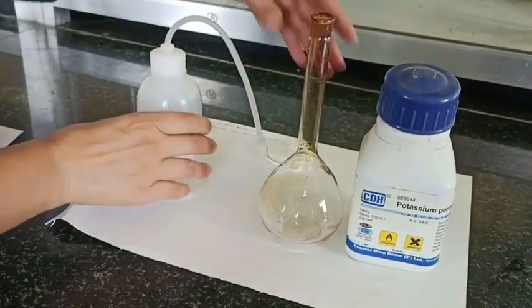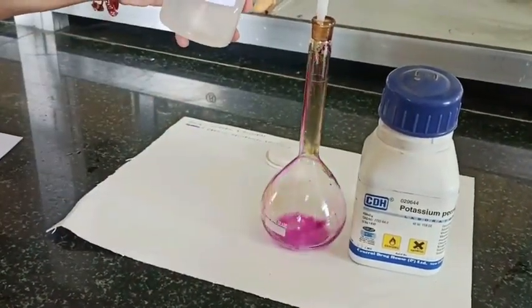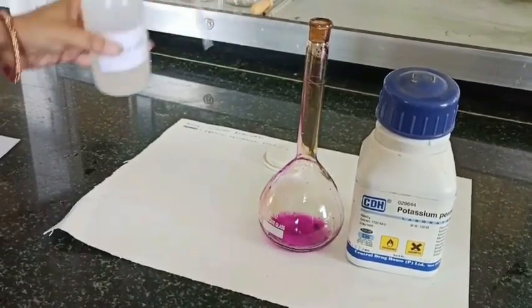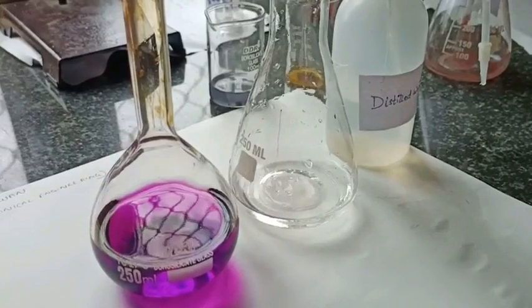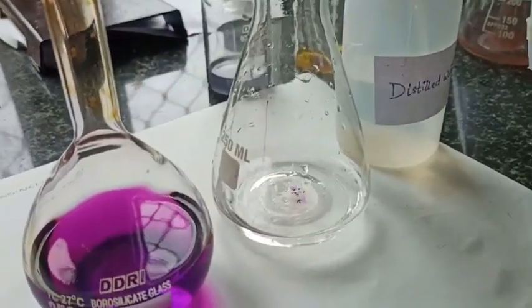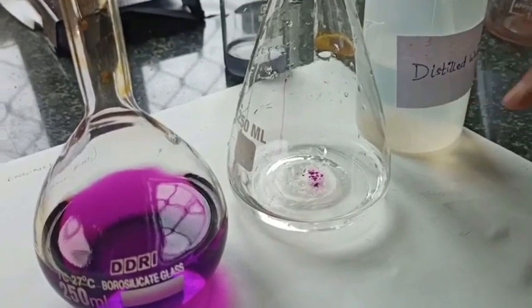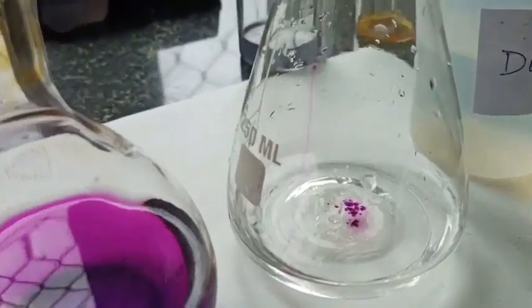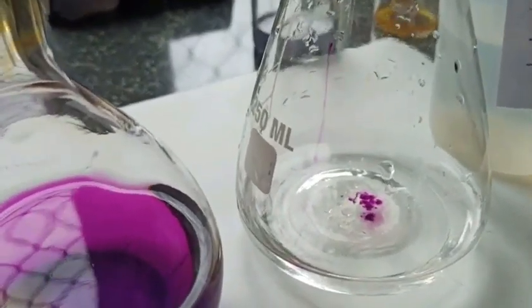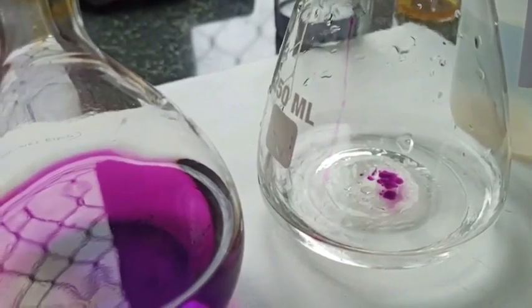I'll just add a few crystals of this KMnO4 into this measuring glass and then add it to the water. You can see how these molecules start moving. First I took the distilled water and added one pinch of KMnO4 particles, and here you can see the movement of KMnO4 particles in this solution.